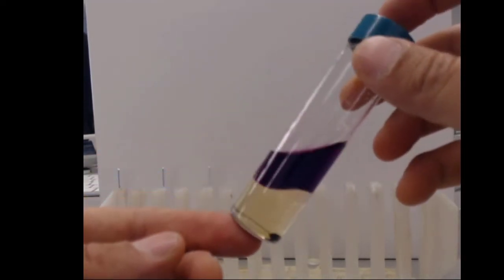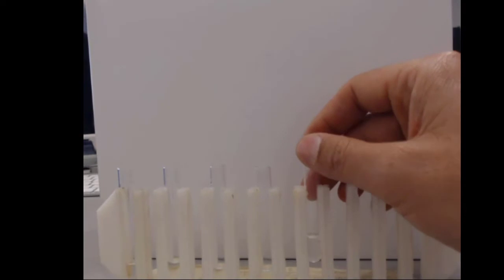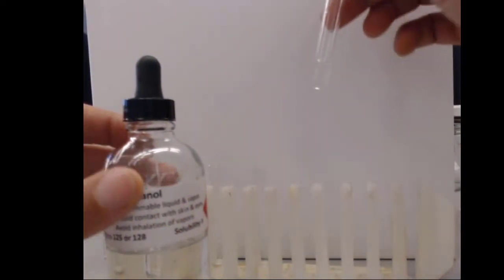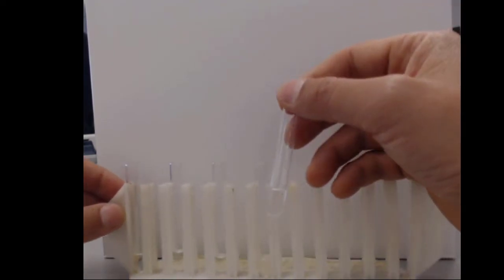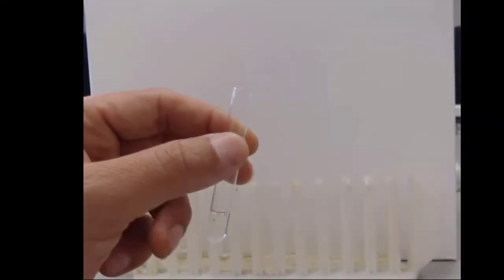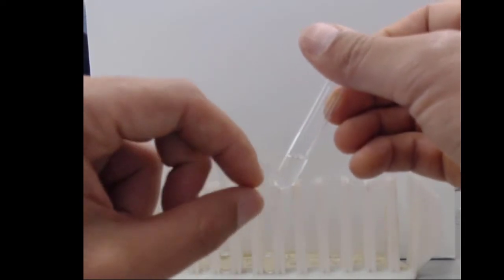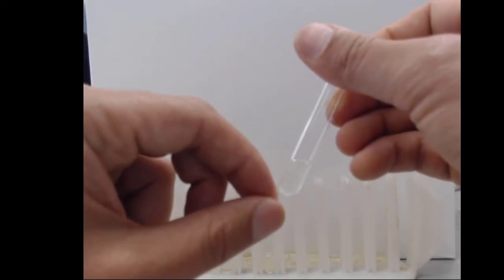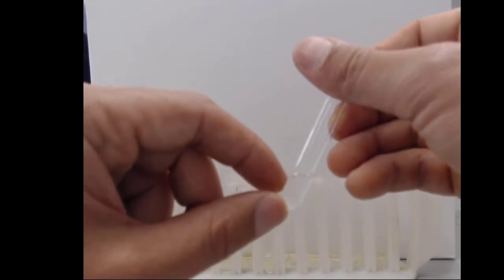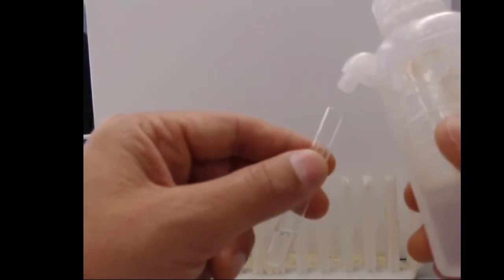So what we're going to be looking for is kind of the same thing we saw with the iodine example, where we ended up with two layers, a water layer and a hexane layer. And the question becomes, for this test tube, which is hexanol, does adding the alcohol functional group make it so that this compound will now dissolve in water, or will it still stay separated? This chemical compound definitely has a permanent dipole moment in the alcohol group at one end. But it also has a nonpolar chain in the form of the hexane leading up to that functional group. So which dominates in this case?